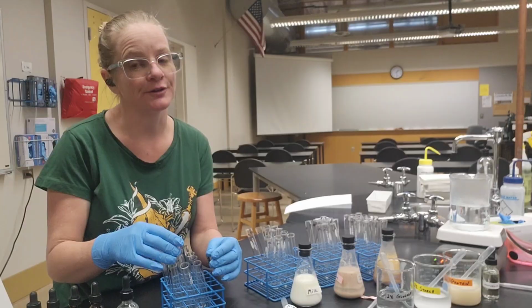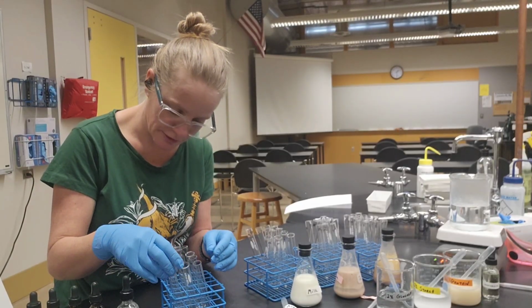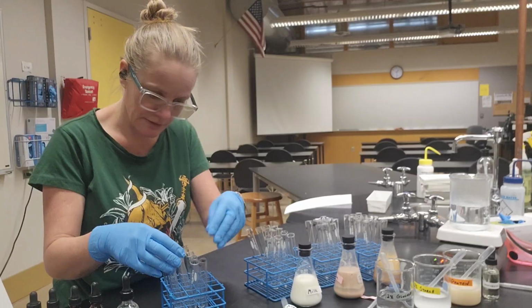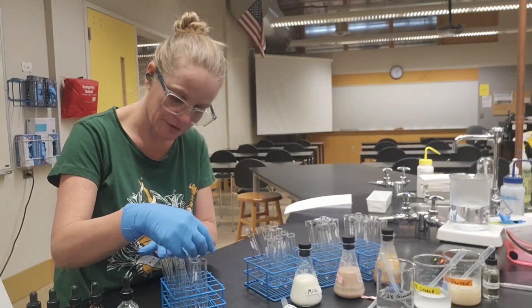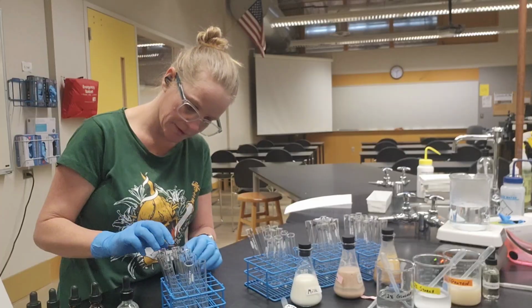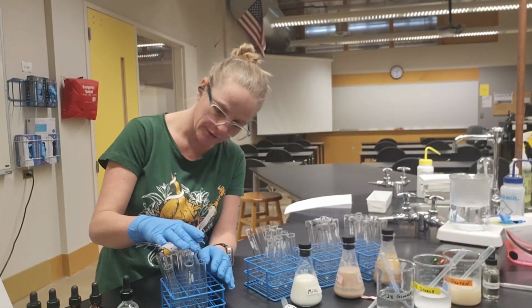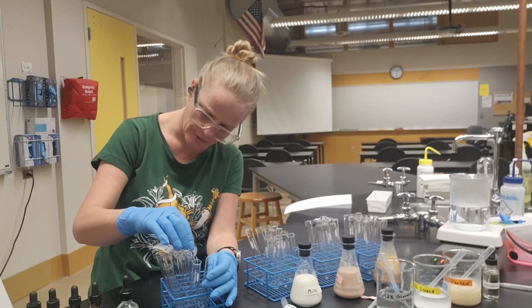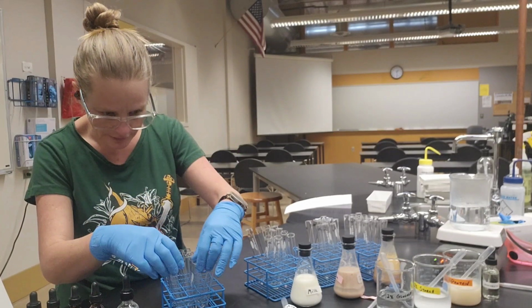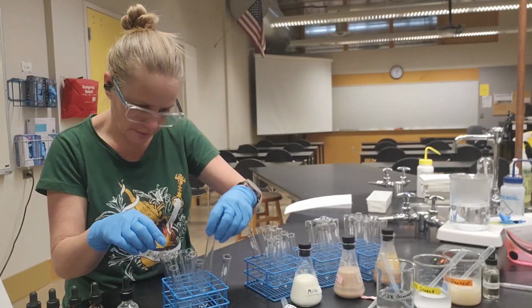And that's a good thing to do whether you're ADHD or not. Okay, so what I'm checking to see is that I have all my simple sugars in the same row, all my starches in the same row, proteins in the same row, lipids in the same row. And then I'm going to check my columns. These are all, ooh, I'm glad I did that because these are not arranged in the same way.